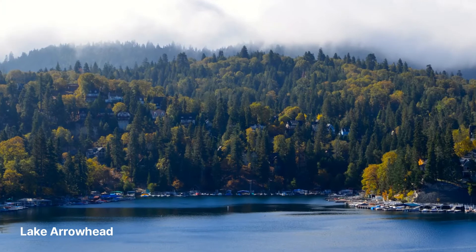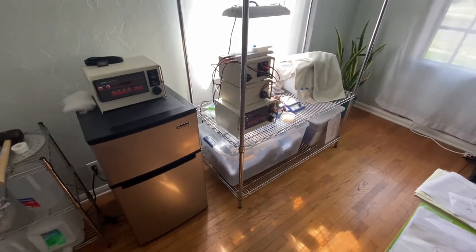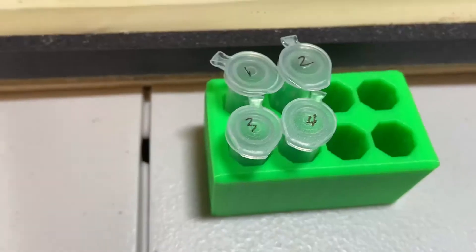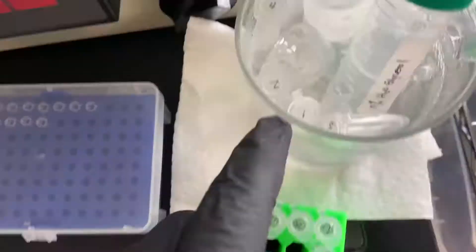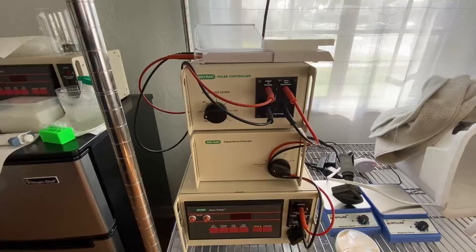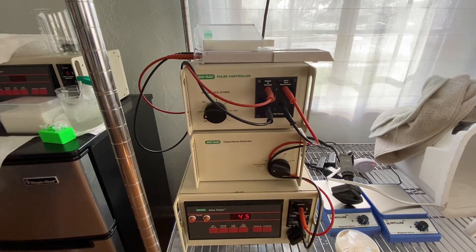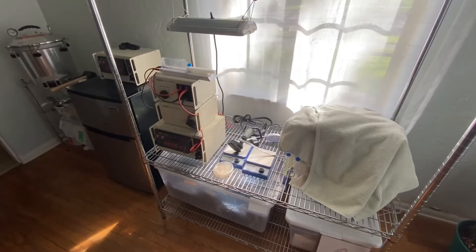At the same time, I had a long weekend trip planned with friends and I really didn't want to leave before trying electroporation one more time. So I went through the process of creating an overnight culture, plated some antibiotic selection plates, electroporated about three to four samples, put them in the incubator, and left for the weekend.